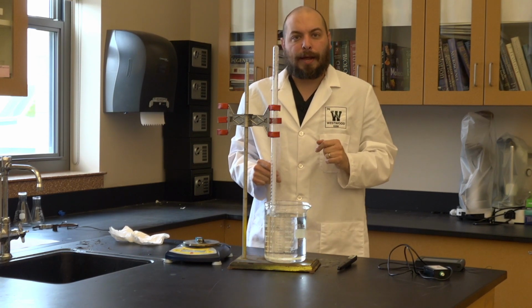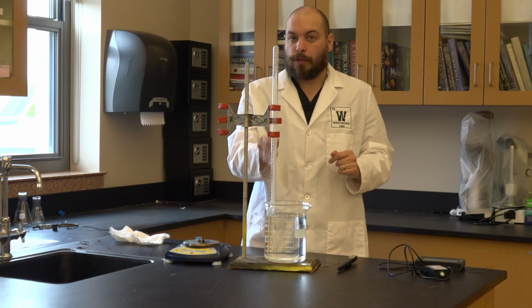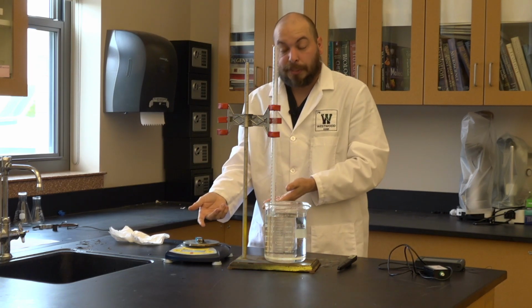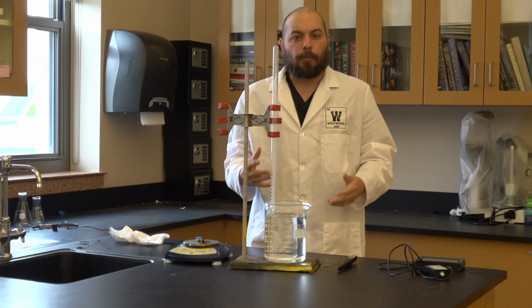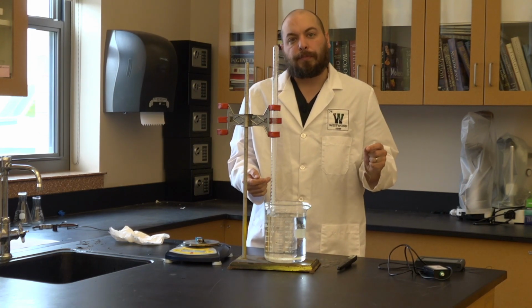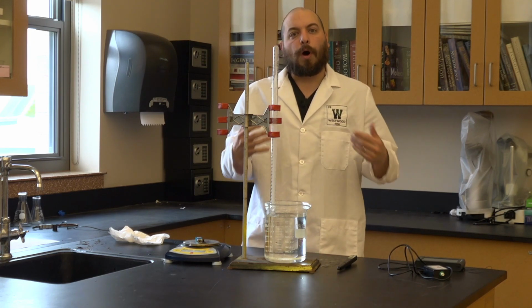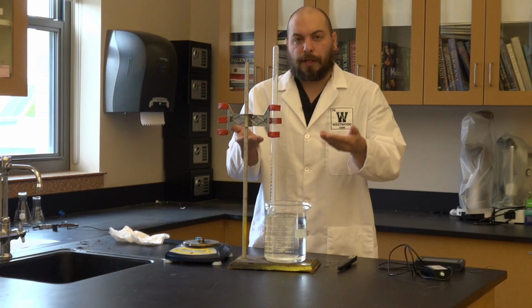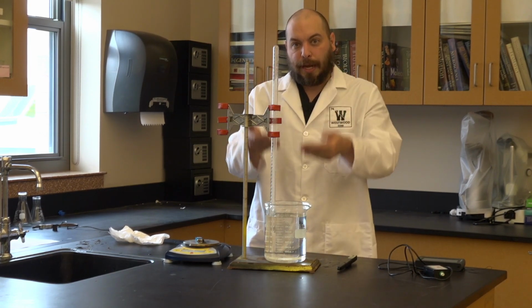The second thing I have to be aware of here, it's not just butane in this eudiometer. You want to think it is initially because that's what we just added to it. But in any gas law problem where we're collecting over water, you also have to account for another variable. This would be the variable that is called water vapor pressure. Water vapor is going to naturally vaporize as we are collecting the gas.